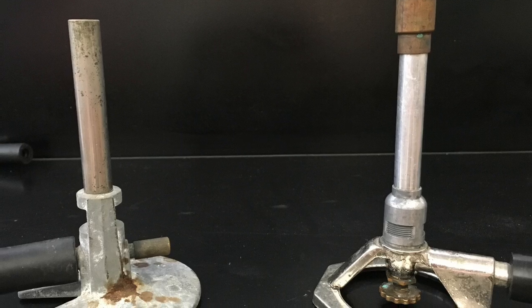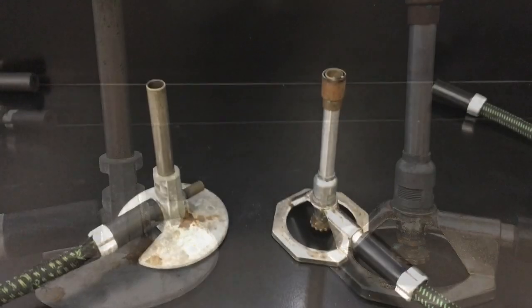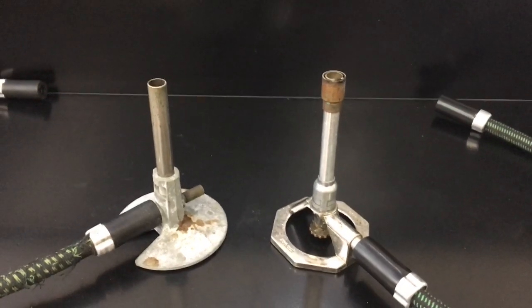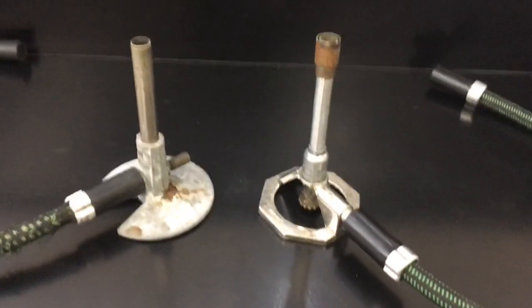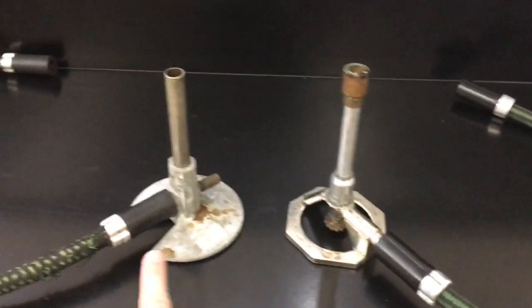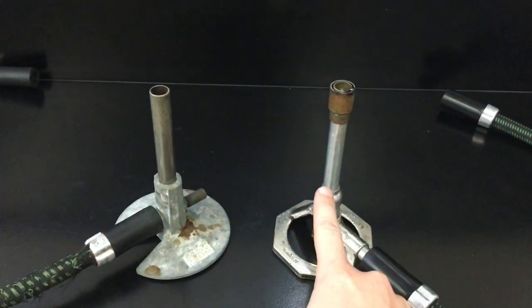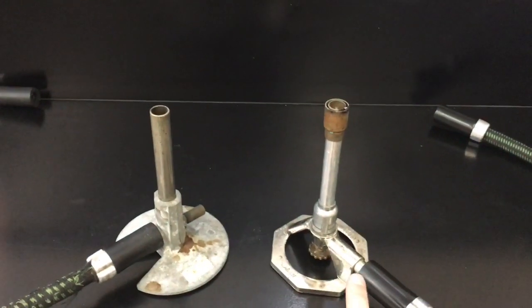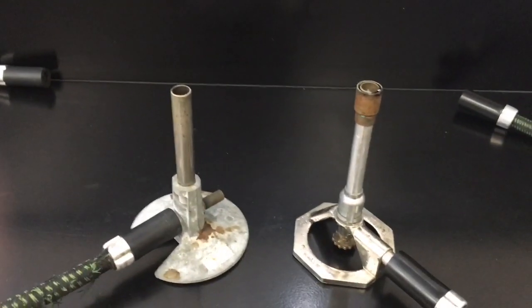We have two different styles of Bunsen burners that we use in our science lab. They actually aren't that different, but some students get confused. They both have the same basic parts: a hose that attaches to the gas valve, and a barrel where the flame comes out the top. They both have vents.